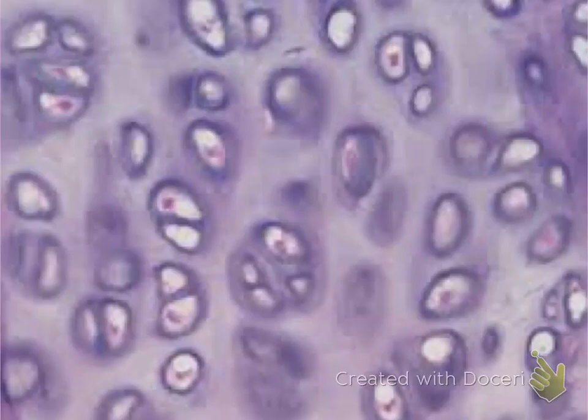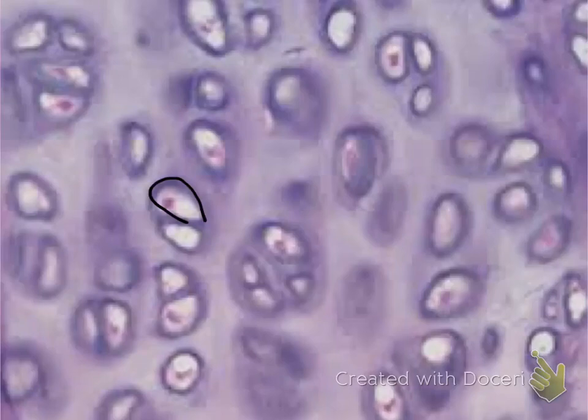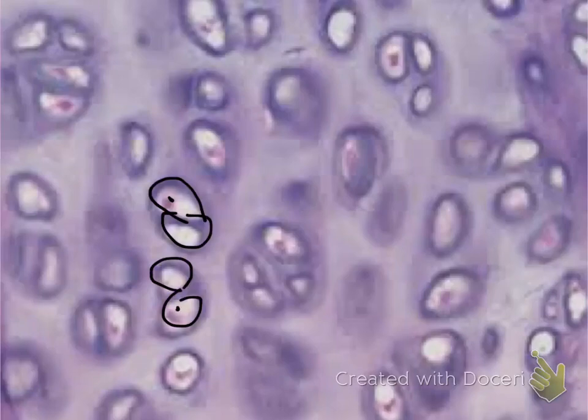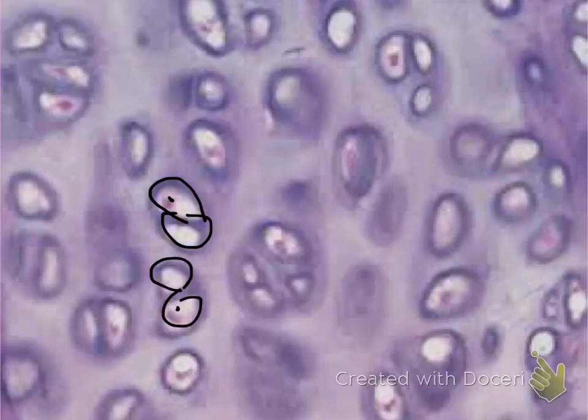Again, notice the appearance of the cluster of double cells that look like eyes — so this is another cartilage cell. Notice that there is no presence of any kind of lines or fibers. So this is your hyaline cartilage.